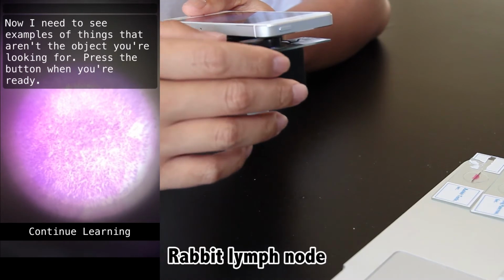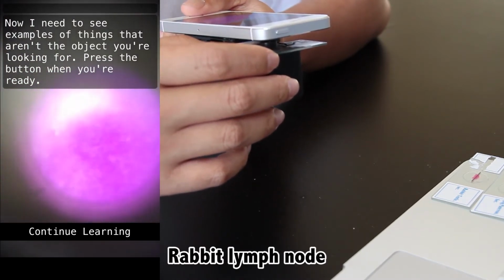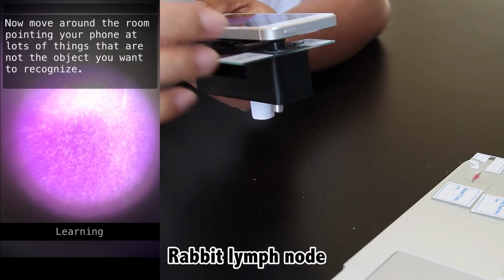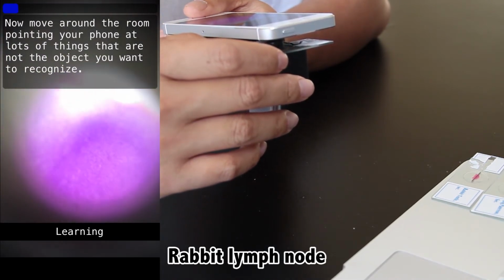So basically, the general idea is that it groups together smaller parts of the image based on their relationships, then takes those groups and their relationships to form new, larger conceptual groups. And in our case with these tissue sections, it might be looking at the small purple spheres, striations, shapes, colors, density of things, and etc.